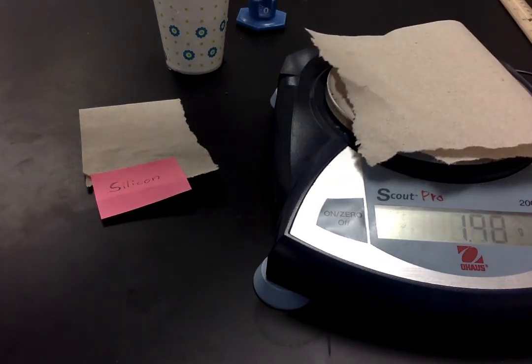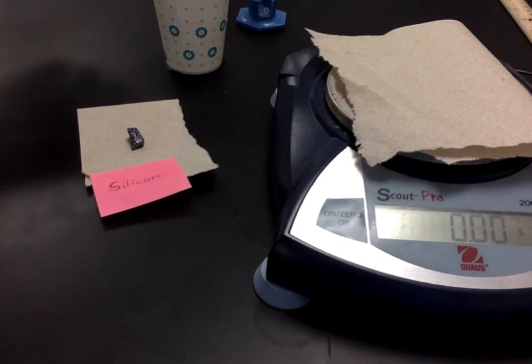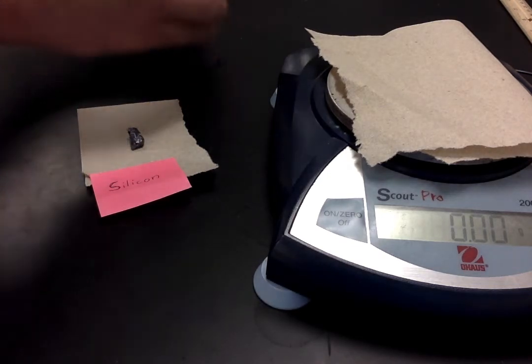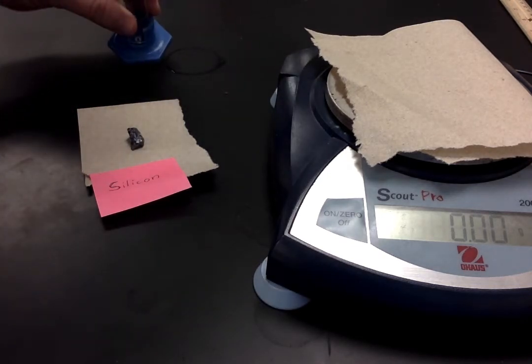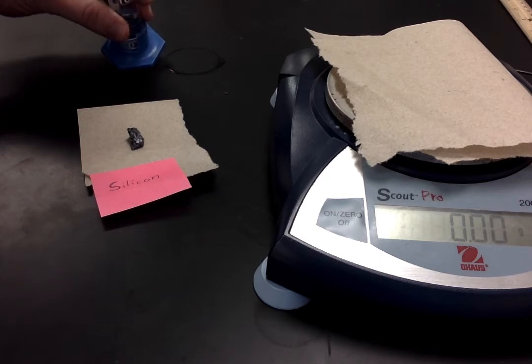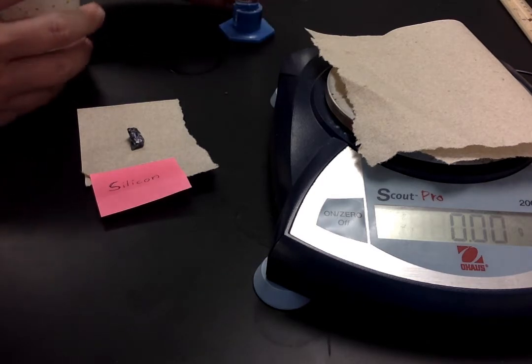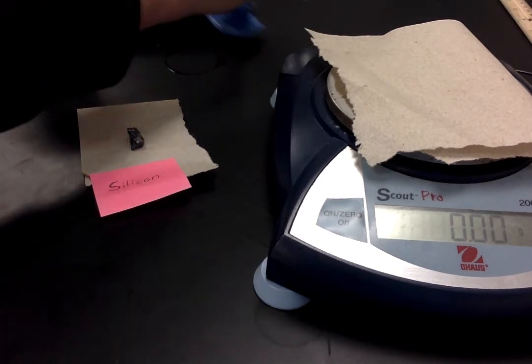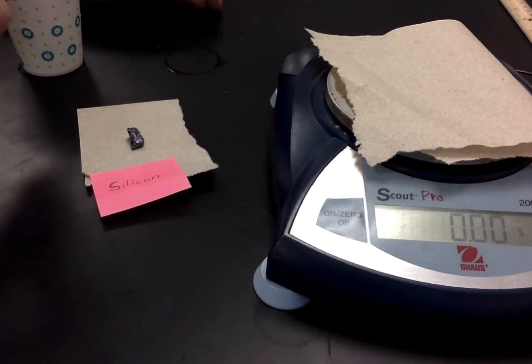And the next thing we're going to do is try to determine the volume of that silicon. So what we're going to do is water displacement. Oh, not great technique, Mr. Brunsvold. Spilled some water.